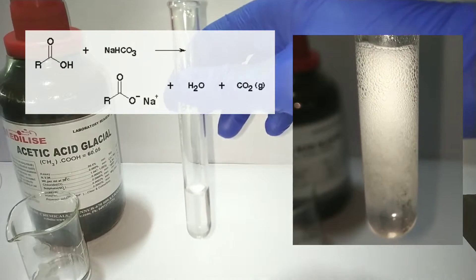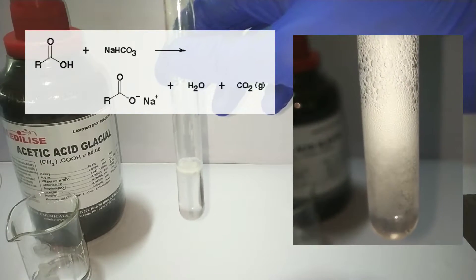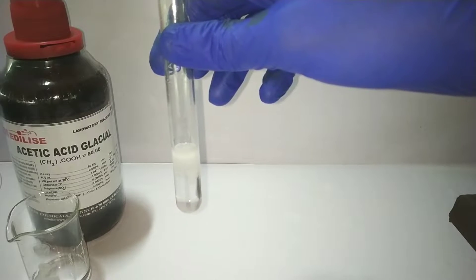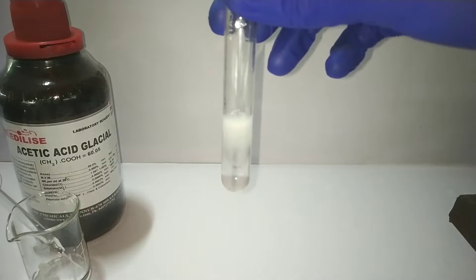Carboxylic acid behaves like any other acid, producing the specific carboxylate salt, and carbon dioxide is released, which is observed as brisk effervescence.